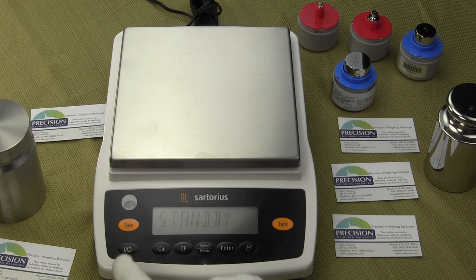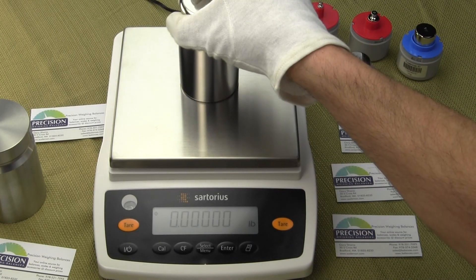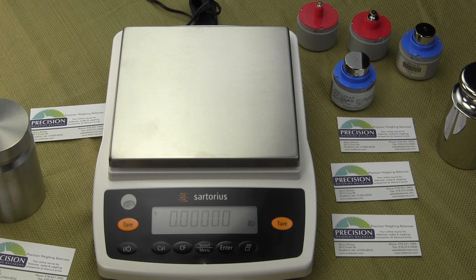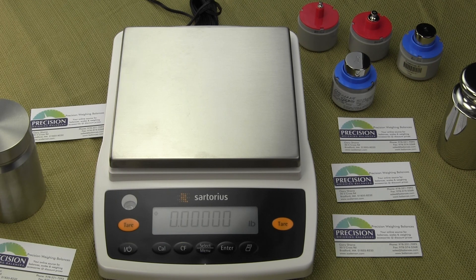If I shut off the balance it goes into standby mode. Power up the balance and you'll notice the weight unit is in pounds. Put our weight on — it's in pounds. That's how easy it is to configure the Sartorius Entris Series. Hopefully this video was helpful. If you have any questions, visit our website balances.com or scaleman.com where you can download the user manual. Setting up the balance for practically any weight mode you can imagine is very easy — you can disable modes to avoid confusion. This is a very configurable balance. The Entris Series is a new balance that was introduced in March of 2014.